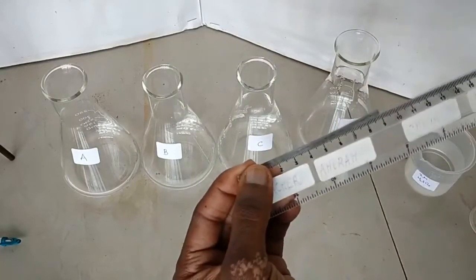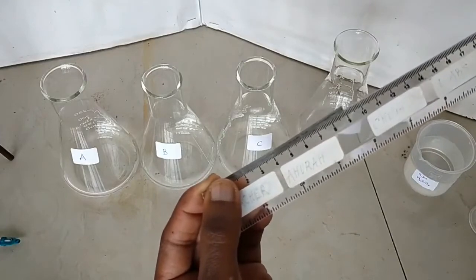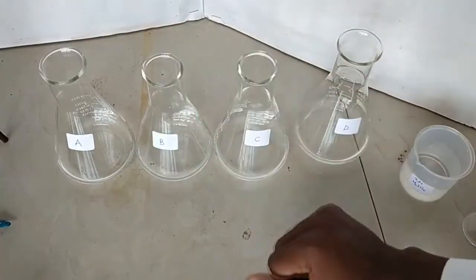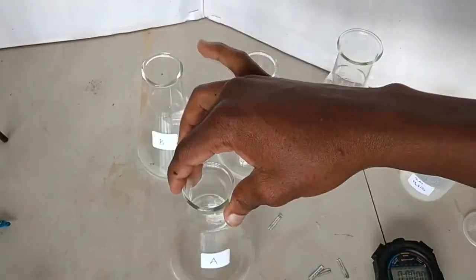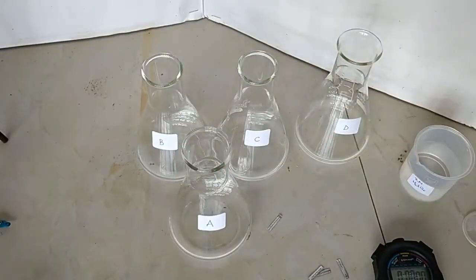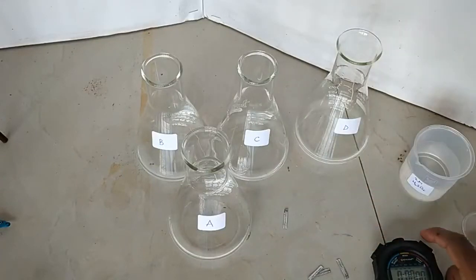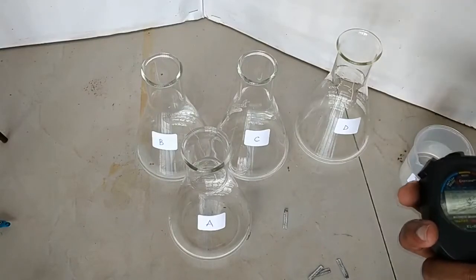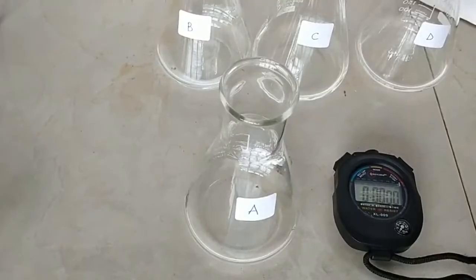I need to cut at 2, 4, 6, and 8 centimeters — so now I have four pieces of 2 centimeter magnesium ribbon. I also need a stopwatch. I'm going to take the first flask, which contains 40 cubic centimeters of 2 molar sulfuric acid, drop in one magnesium ribbon, start the stopwatch immediately, and watch it until all the magnesium is used up, then stop the stopwatch.